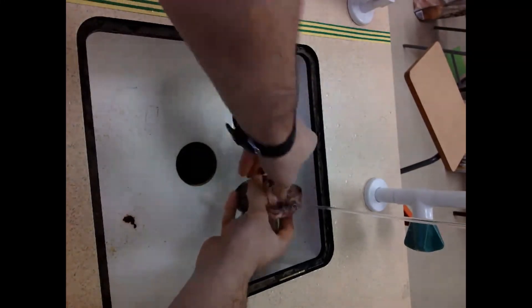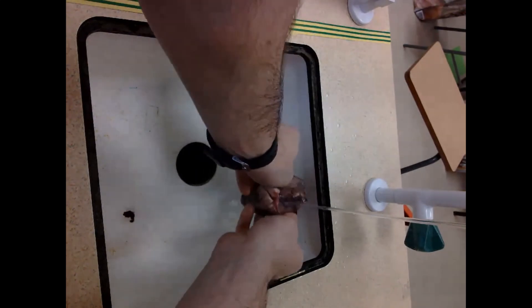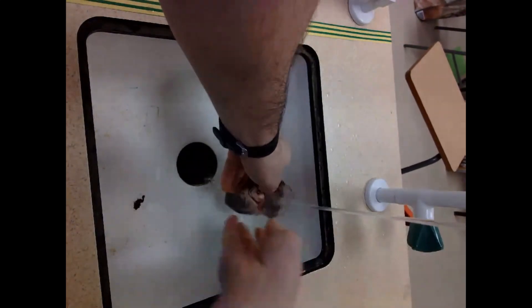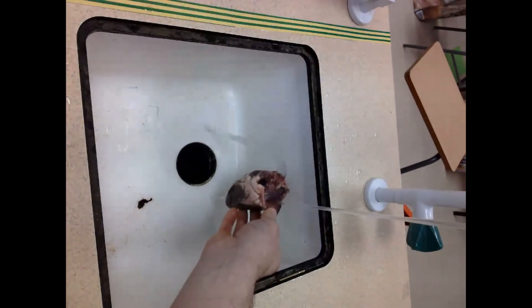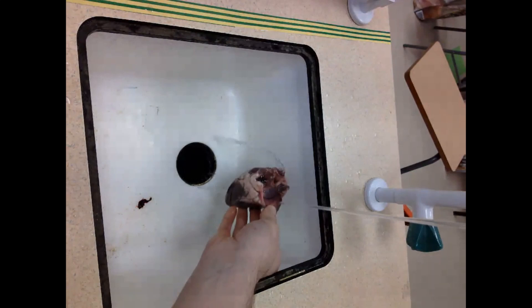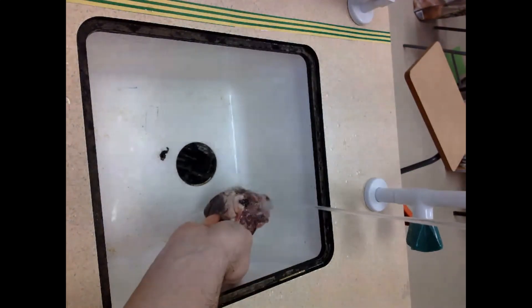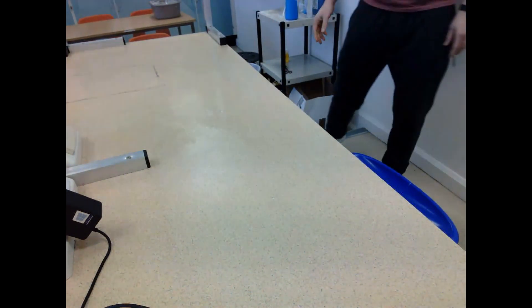This experiment is our heart dissection. Here I'm just washing out the heart, trying to get any blood clots out - you can see a nice big one there in the sink already. I then put the water into one of the atriums and you can see it firing out the top of one of the blood vessels on the far side - blood going in one end and fired out the other.